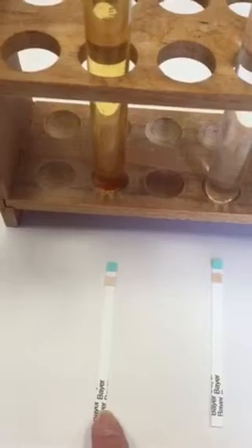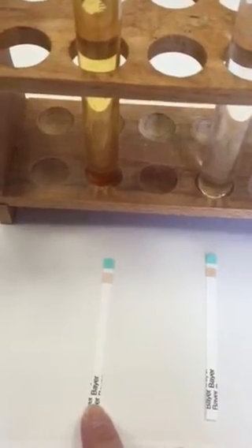If there are simple sugars or simple carbs present in the apple juice, then the indicator — this is a glucose test strip — right now they haven't been used. In the case of water, our control group, if there are no sugars present, the glucose test strip will stay the same. If there are simple sugars in the apple juice, then the glucose test strip is going to turn dark brown.